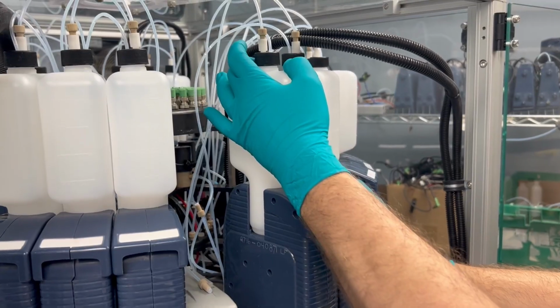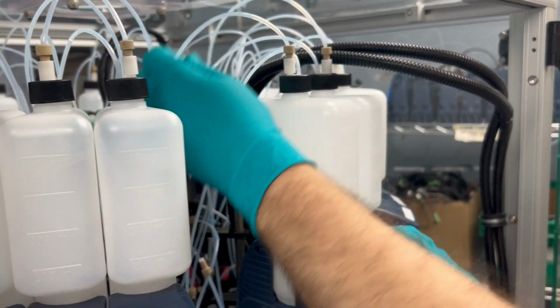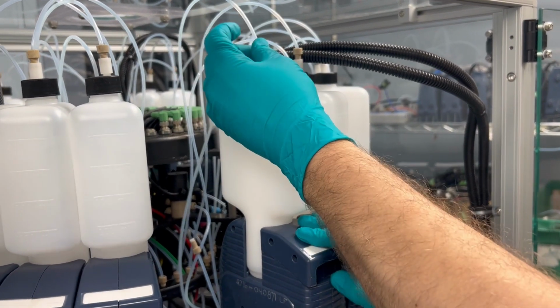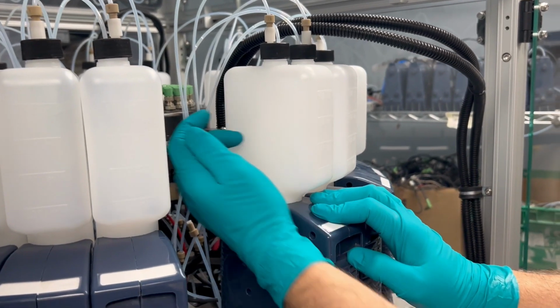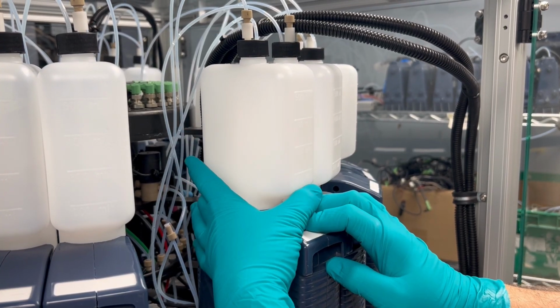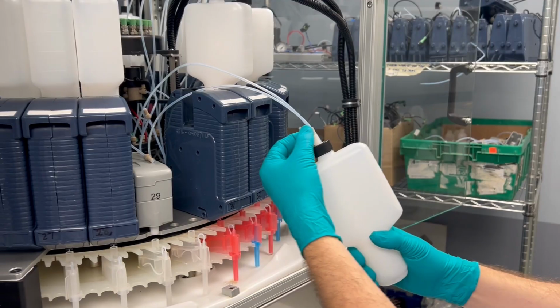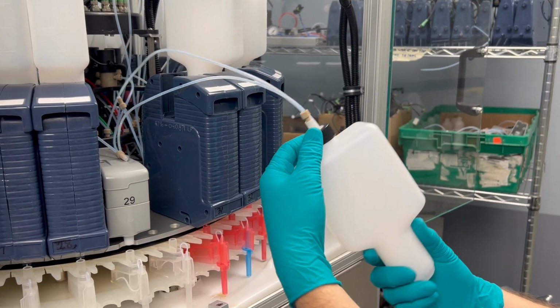So on the top of the bottle slide, you have a nitrogen tubing. This will go to the nitrogen ring, which is what will supply the nitrogen to the top of the bottle. The purpose of that is to keep a nitrogen level over top of each of these chemicals. So next, we can remove this. As you can see, it will go into the bottle on the left side and the fluid supply will come out on my right side.